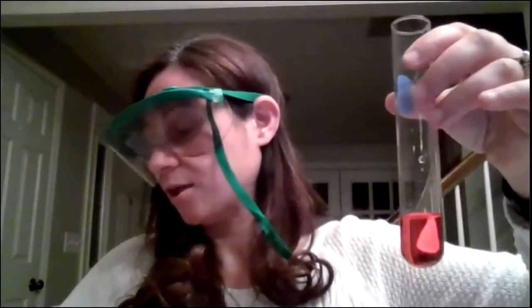And I'm going to take the first one and I'm going to add to it a drop of some HCl. So the color is green right now. It's about pH of 7 or so. I'm going to add some HCl to it. And I added only like a drop. And a drop of 0.1 molar, so pretty weak acid, weak concentration, I should say. And it drops it all the way to probably 1 or 2. And so dramatic change in the pH.